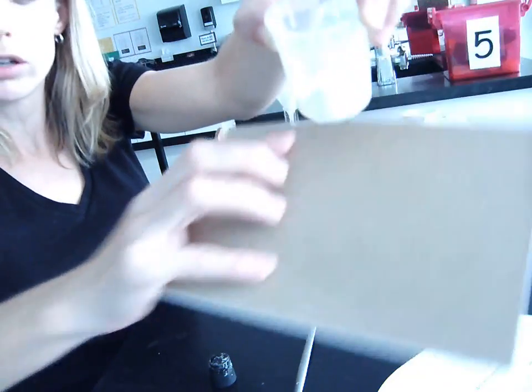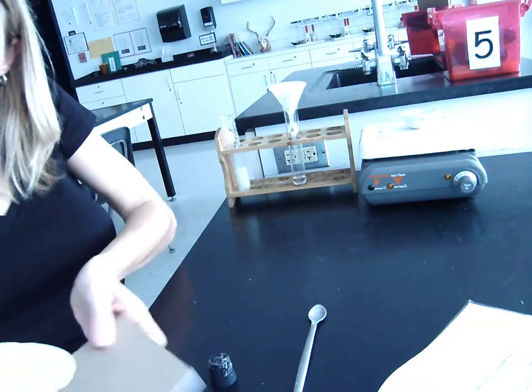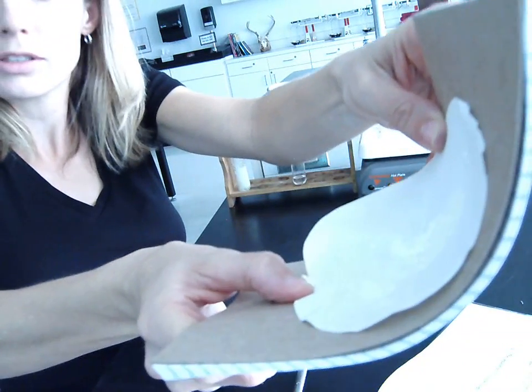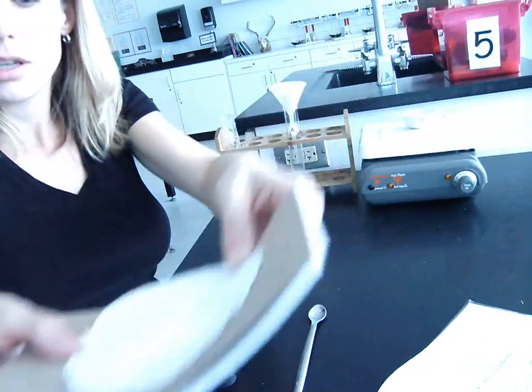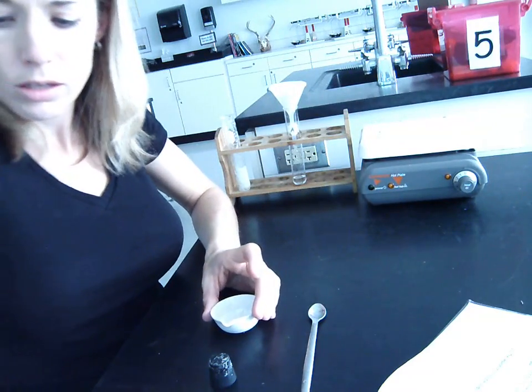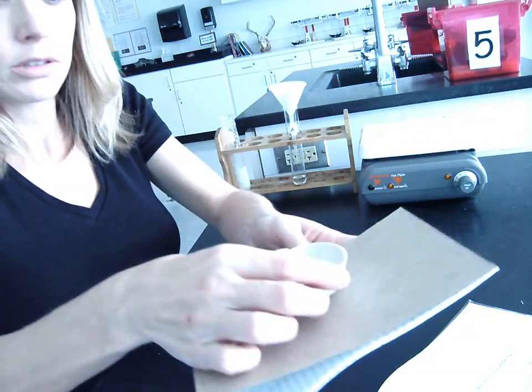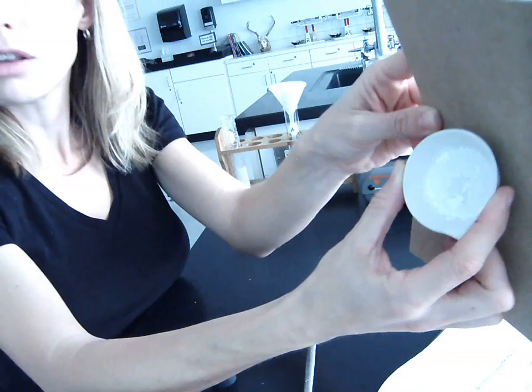Then we put some of it in water. We filtered it through the paper. The sulfur got stuck in the filter paper, and when it dries out, we have essentially separated the sulfur. Let's try to do this so you can see it. We've separated the sulfur from the salt. Now, once all the water's evaporated, you can see that we have in our evaporating dish, hopefully this will work, there it is. You can see the salt left over.